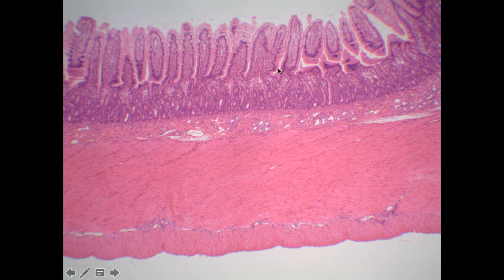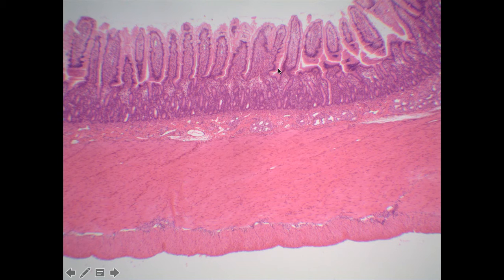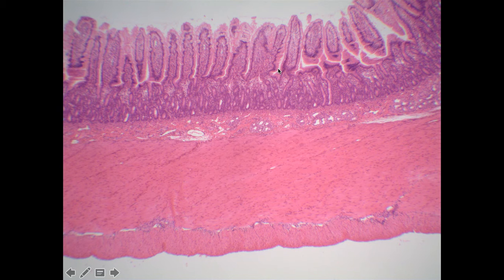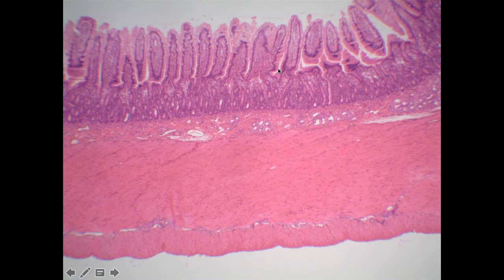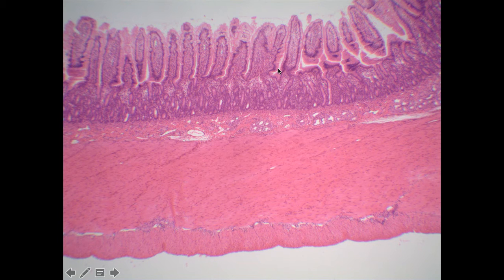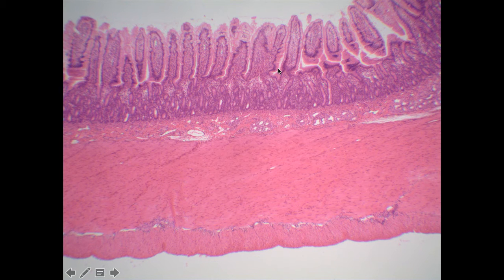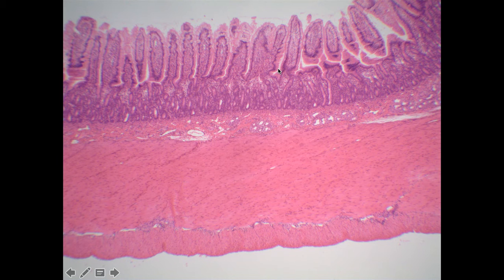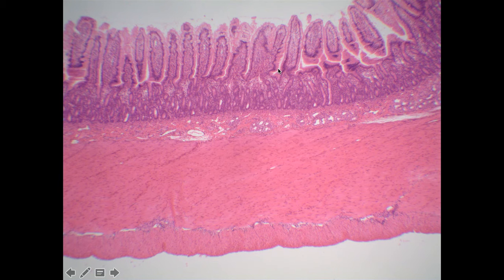In the small intestines, there are going to be three different regions that you need to be able to identify based on histology. Those are the duodenum, the jejunum, and the ileum.